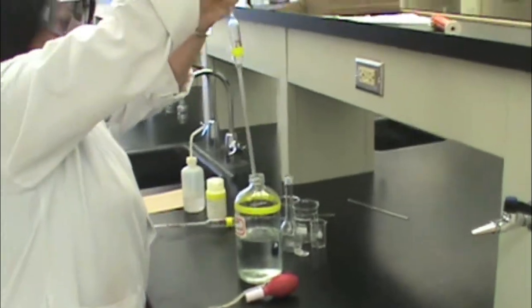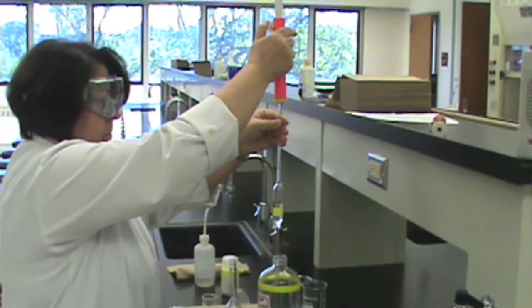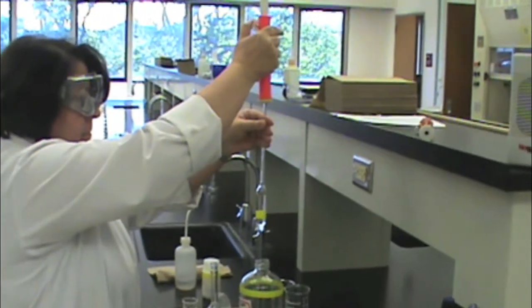Then place the pipette into the solution. Turn the wheel to draw liquid up into the pipette, making sure that the level of the liquid is above the line marked on the pipette.